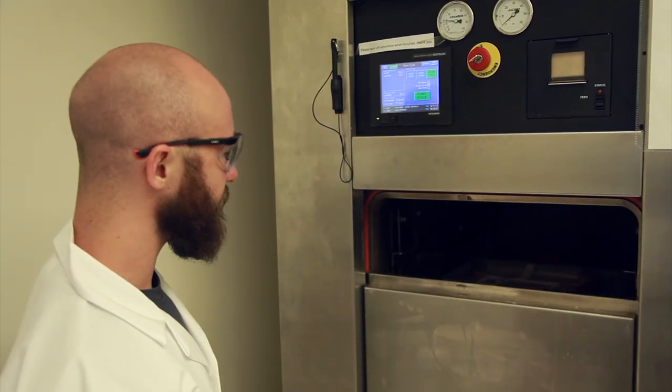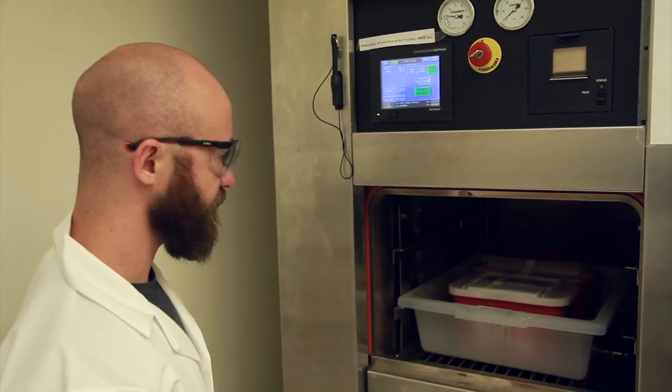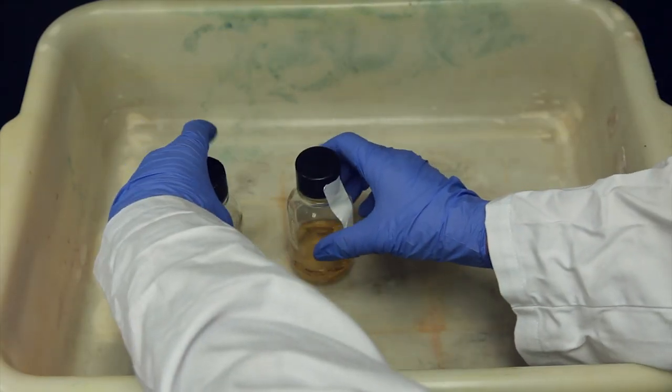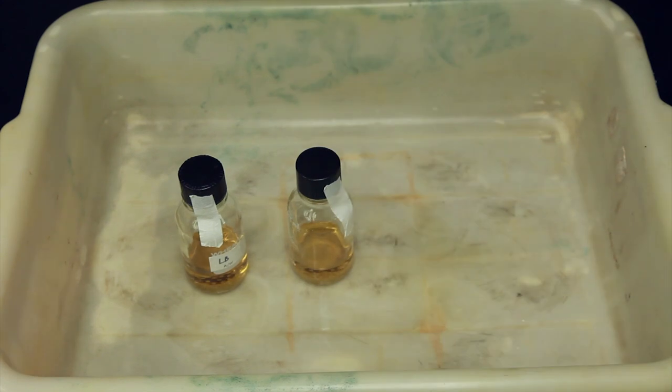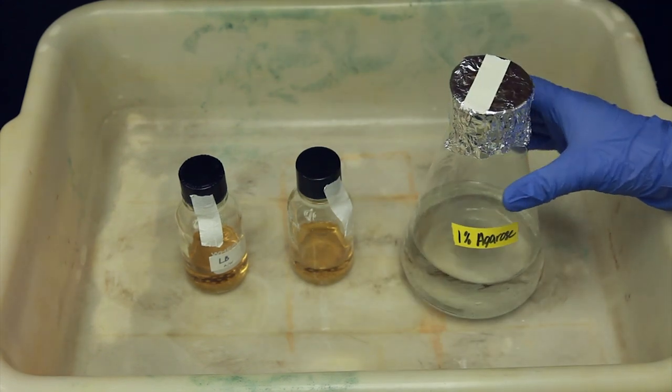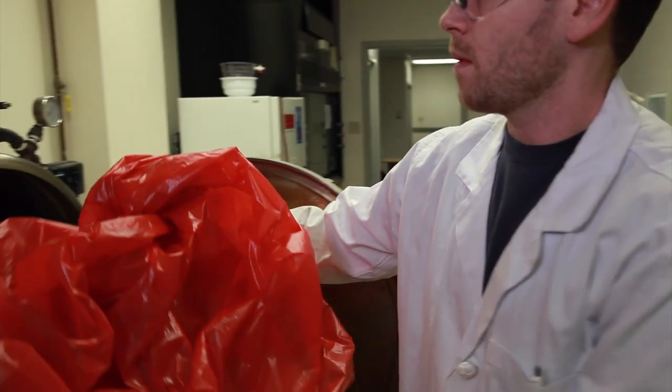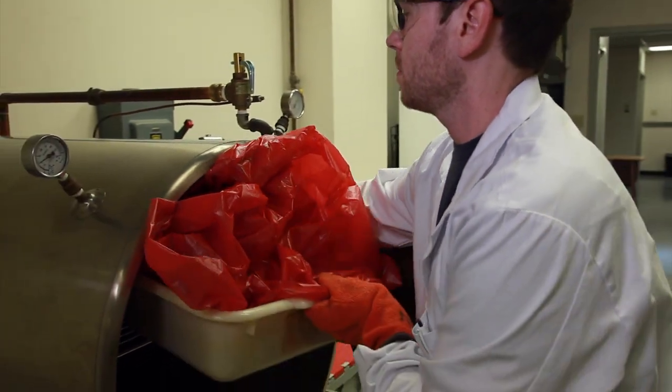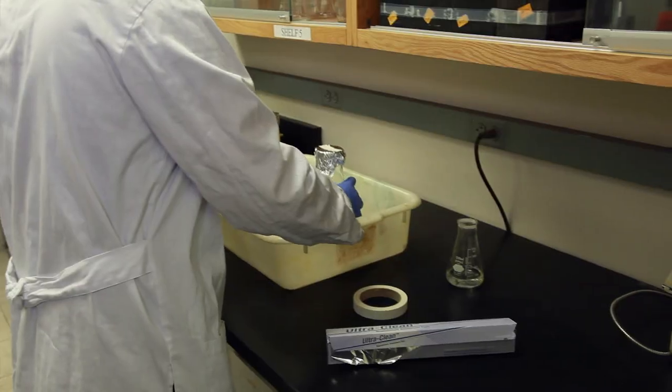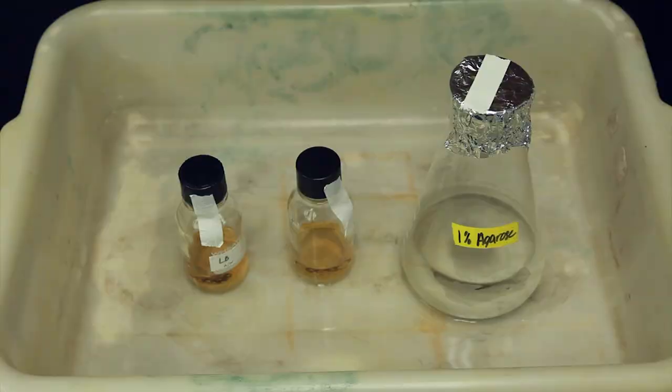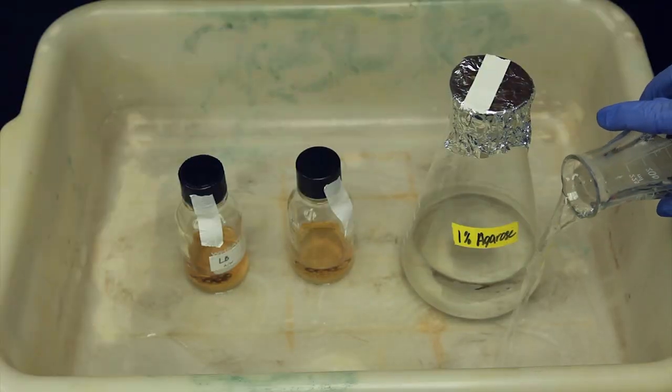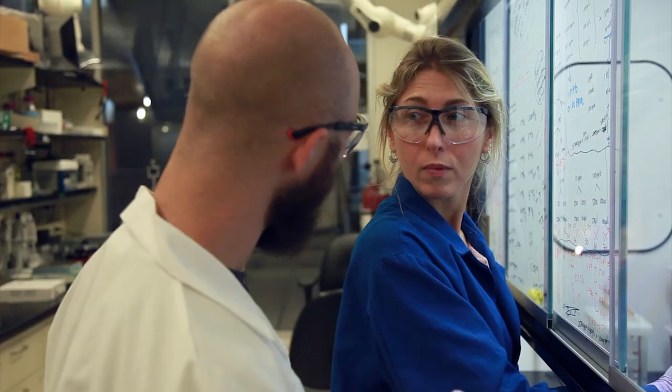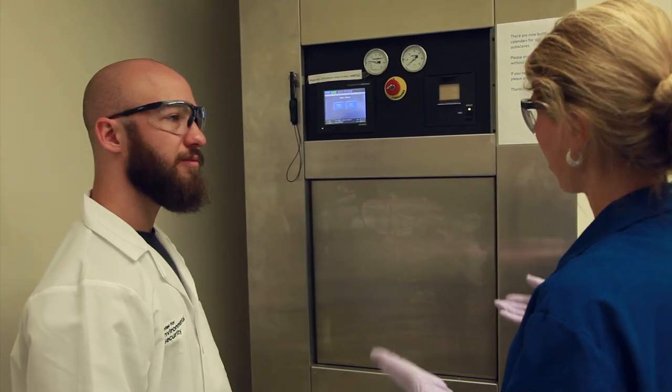All autoclave uses should pause until the unit is in proper working order. Be sure that all the materials to be autoclaved are loaded in the autoclave bin or an appropriate rack or other container to reduce chances of spills and improve ease of removing items from the autoclave. Do not overload the autoclave. Leave sufficient room for steam circulation. Depending on the materials you are loading, it may be prudent to add water to the pan prior to autoclaving. If you have any questions, be sure to ask your supervisor for guidance. Communication is key.